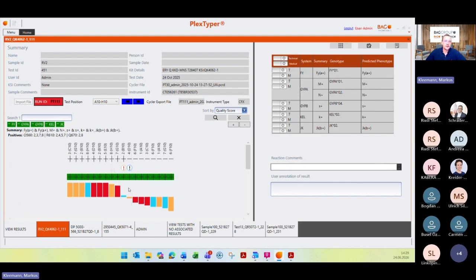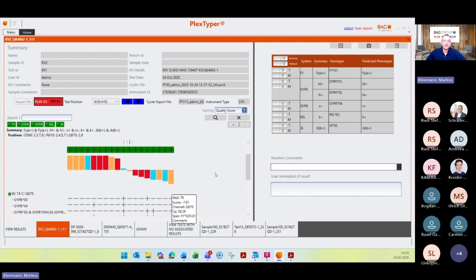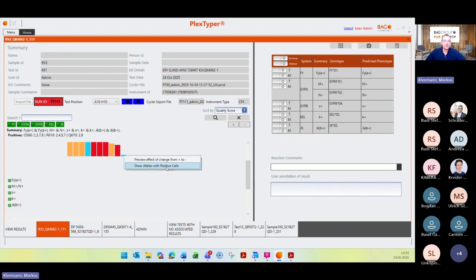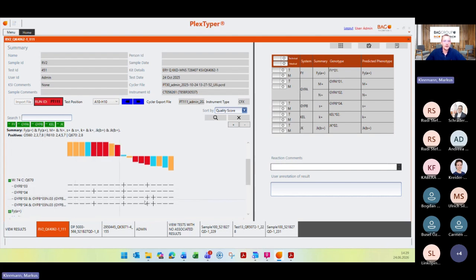But what you can do, for example, in this case also is when you go here and click show alleles with positive calls. So PlexTyper says for this reaction here with this specimen, this one was positive. I mean, with a bad score, right? But PlexTyper says, okay, this is a positive one. What you can do is click the right mouse button and go to clear alleles, I do it again, show alleles with positive calls, then you can see here a list of which reactions have to be positive for these genotypes here. And when you see this, you can compare your reactions.